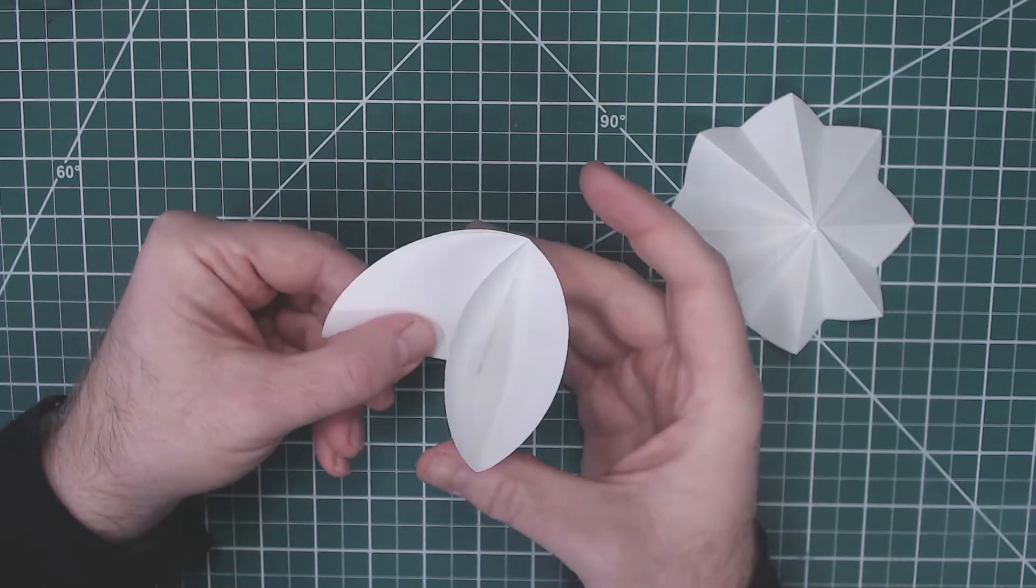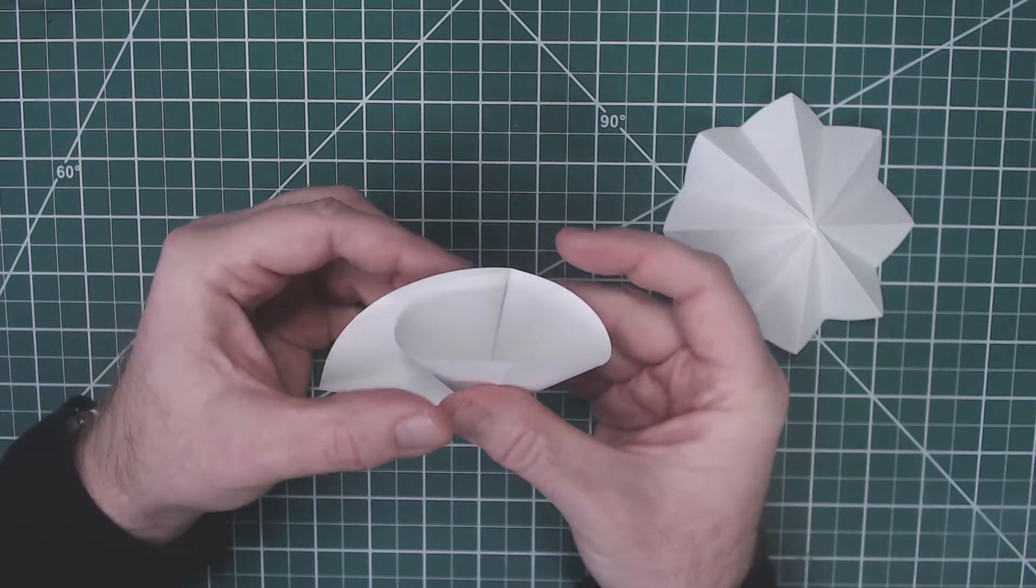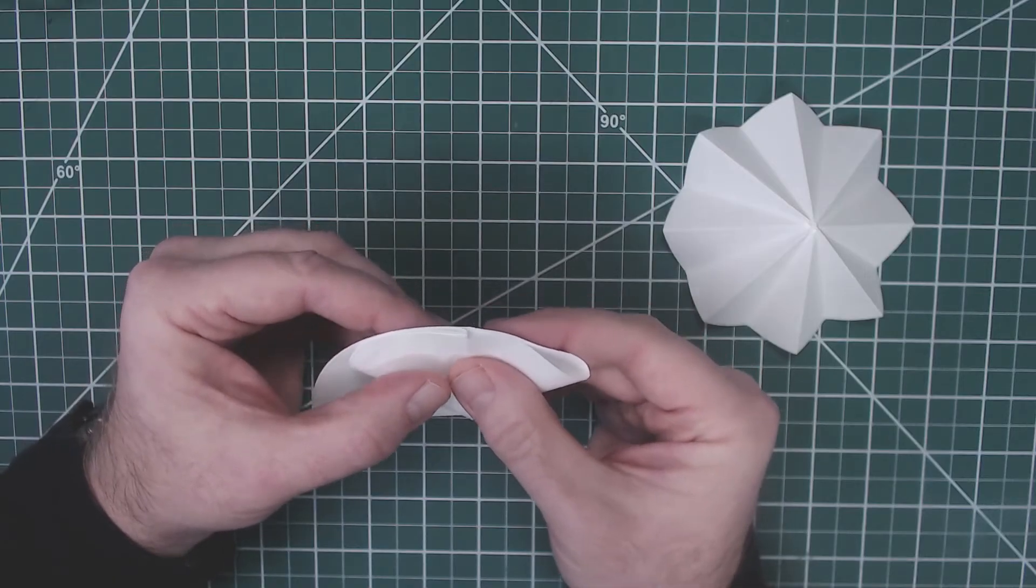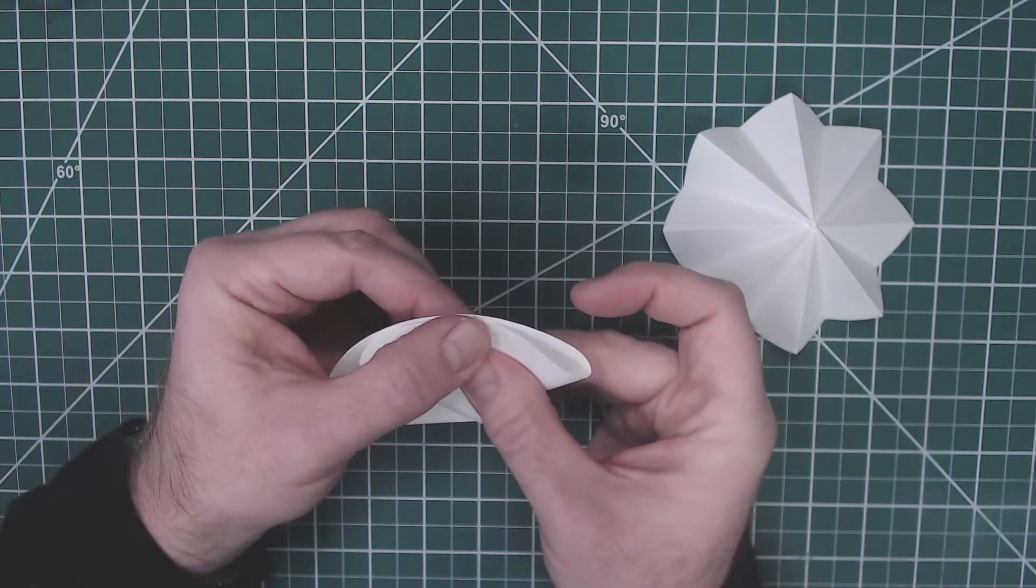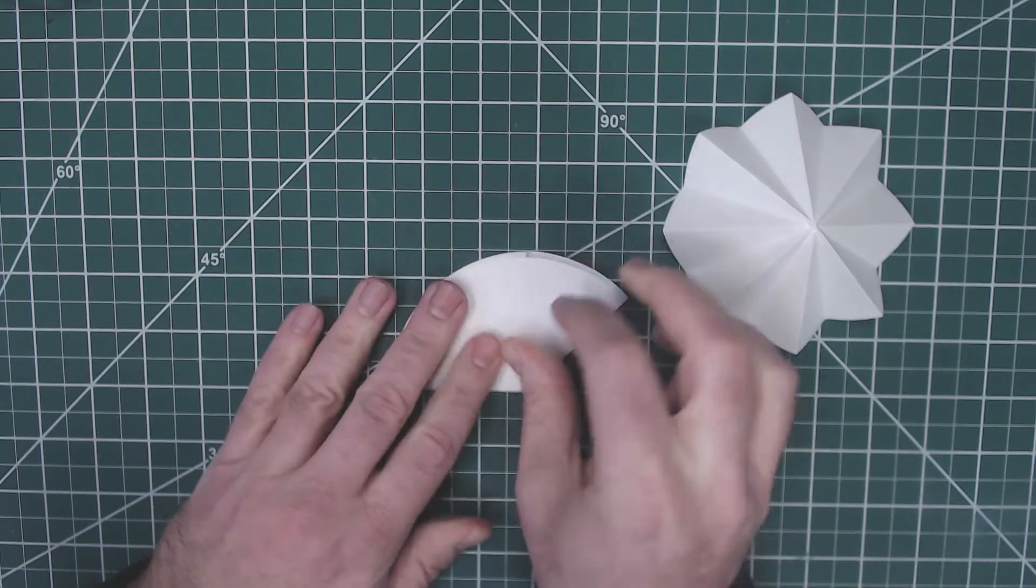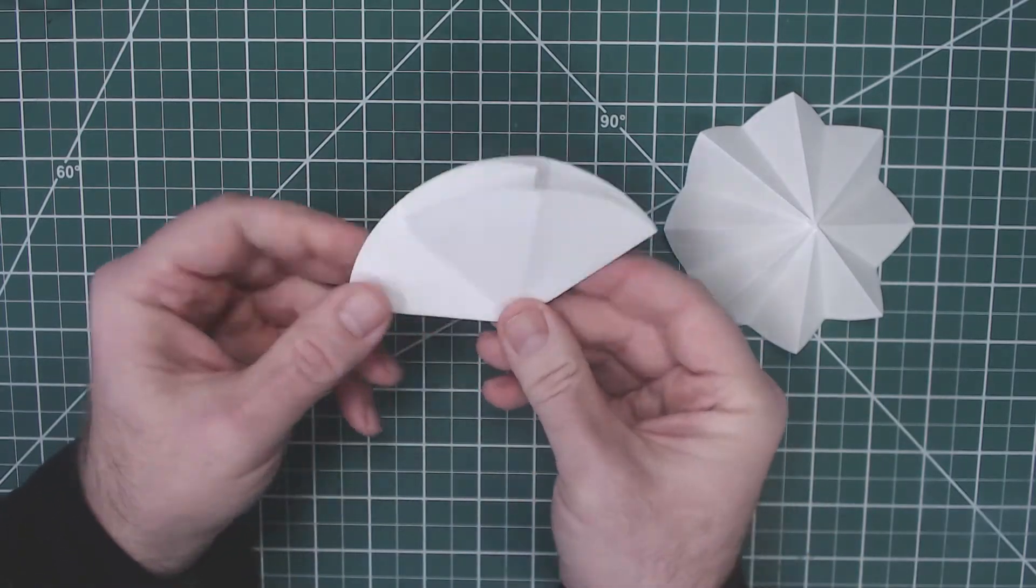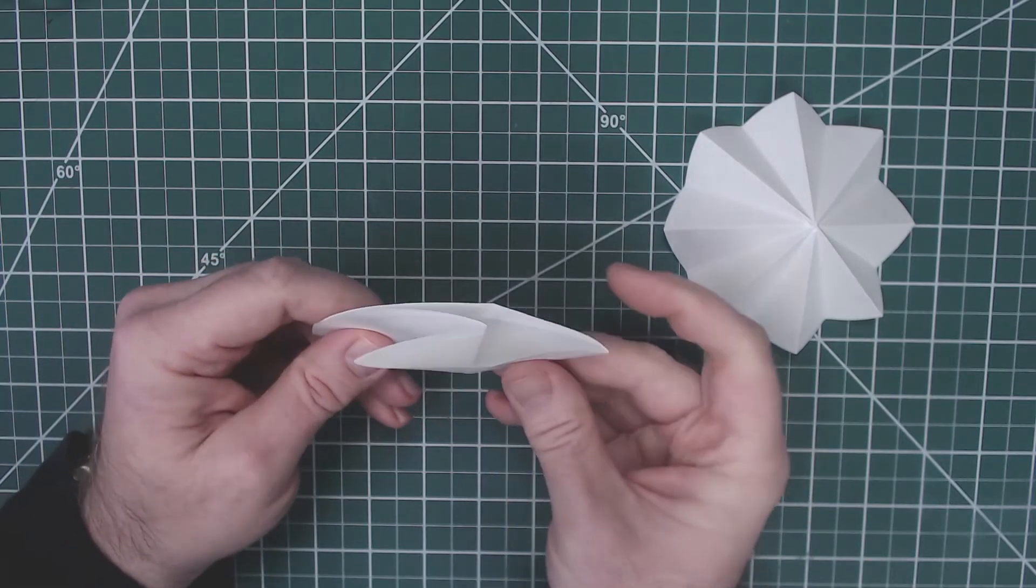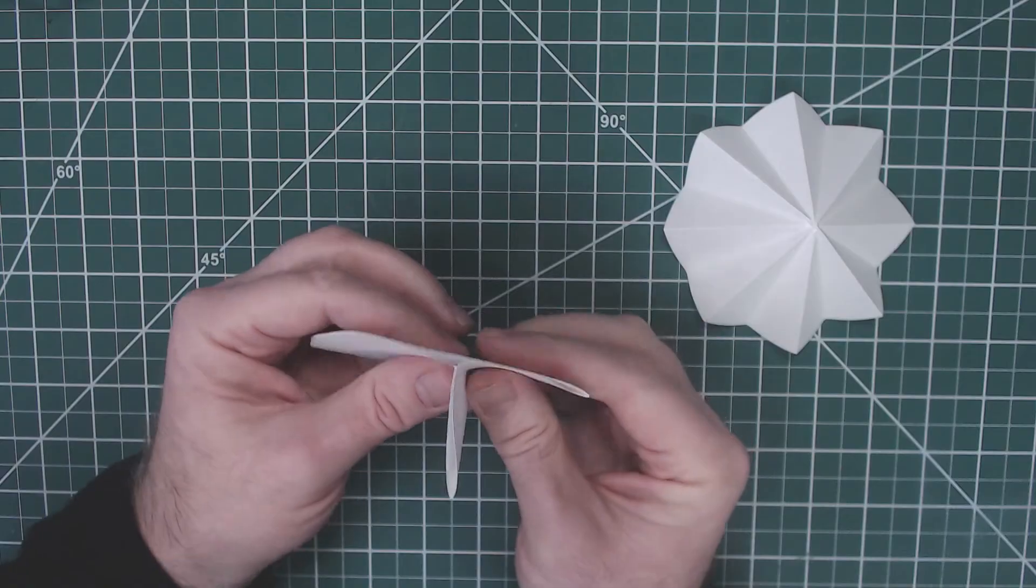Taking our piece of filter paper that we folded into quarters, we're going to take that and fold it again. We're going to push this crease so that it lines up with the middle crease. When we do that, we've got something that looks like three-eighths of a circle.